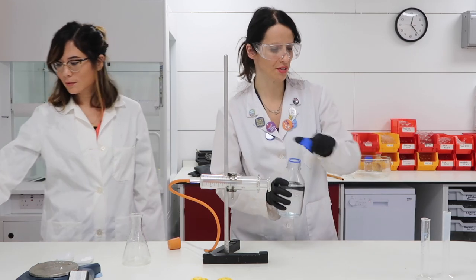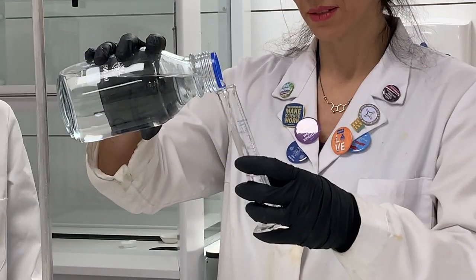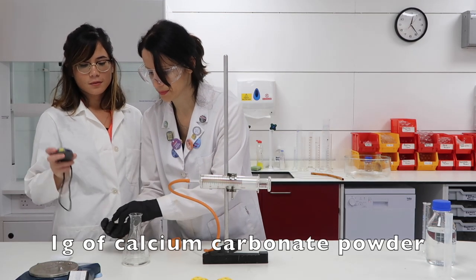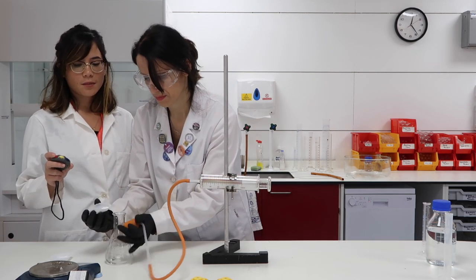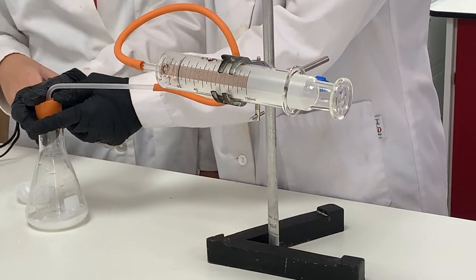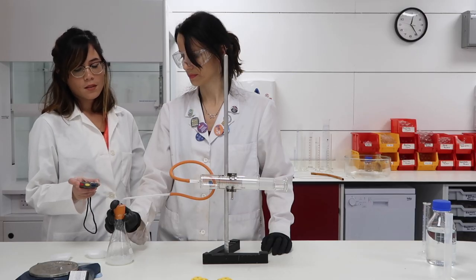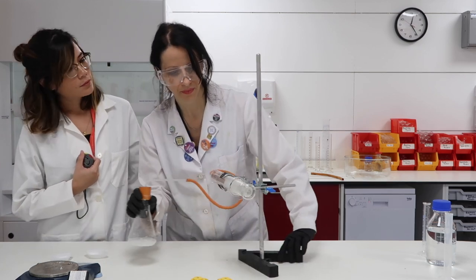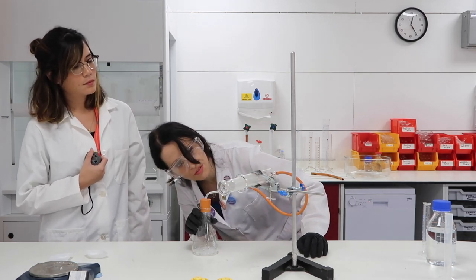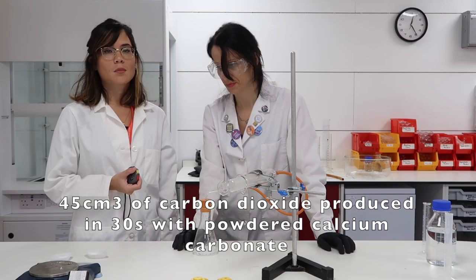I'm going to measure 25 ml of 0.5 molar hydrochloric acid and we'll start with the powder. Starting the stop clock immediately. That carbon dioxide has already been given off — we can see the fizzing taking place. 30 seconds has passed. The volume is 45. So we've produced 45 centimeters cubed of carbon dioxide using the powdered calcium carbonate.